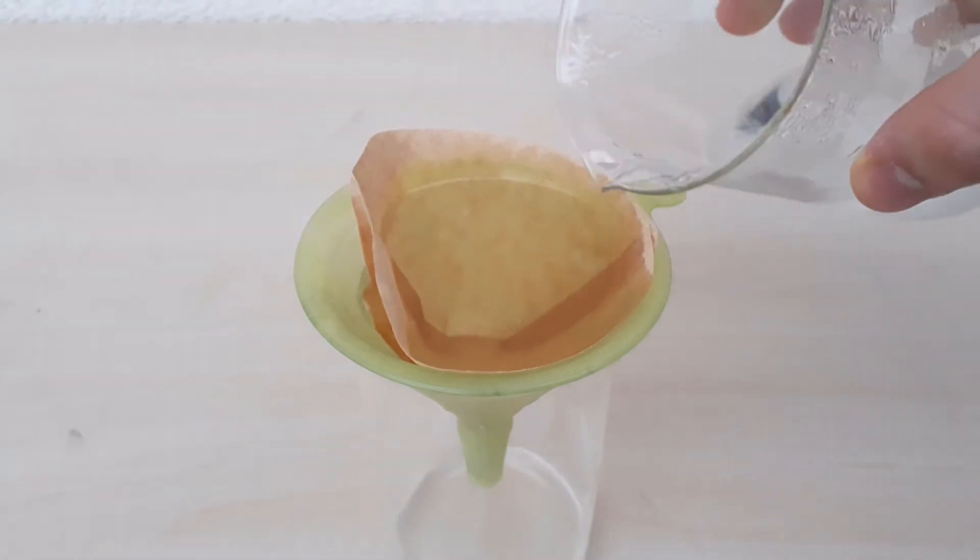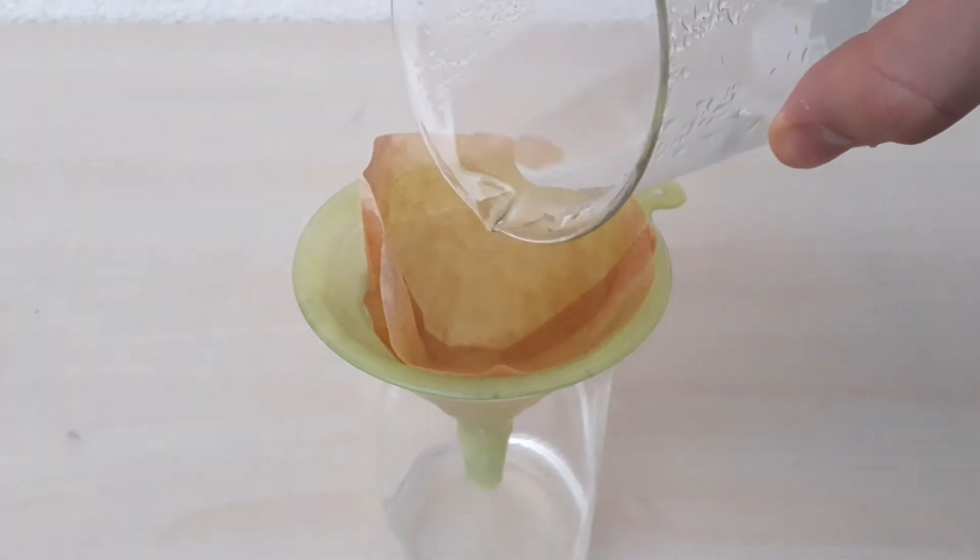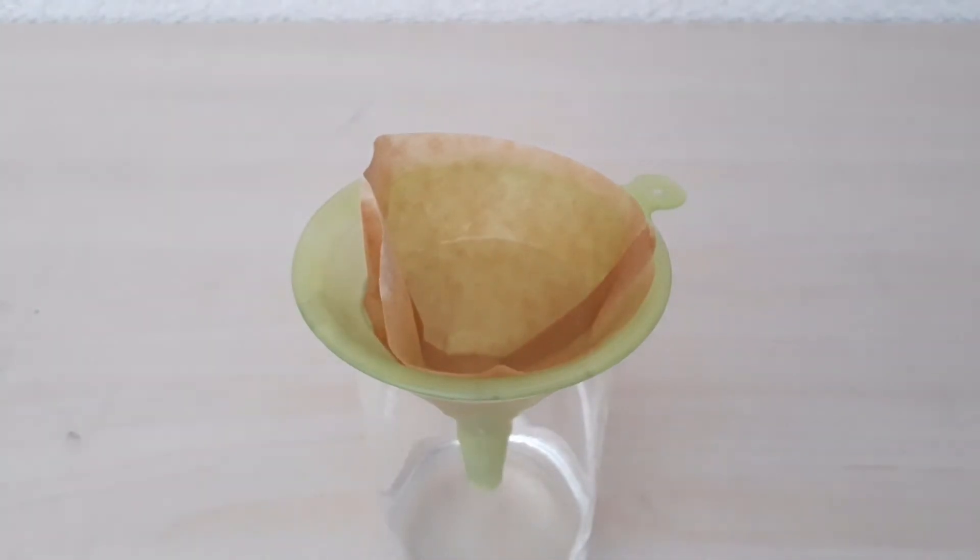The next day I pour all the residual liquid through a filter into a clean beaker. This residual solution can be left to stand and evaporate slowly to get even more and nicer crystals of potassium sulfate, but I was more interested in the finer crystals for my purpose.